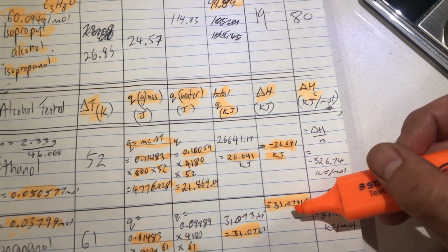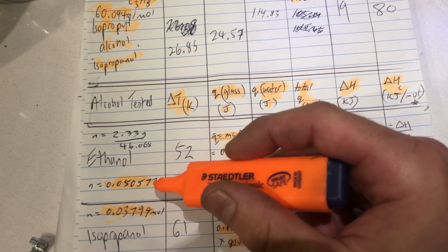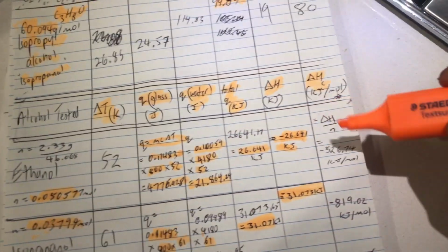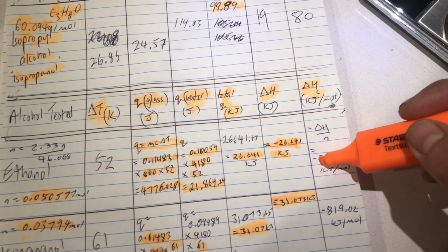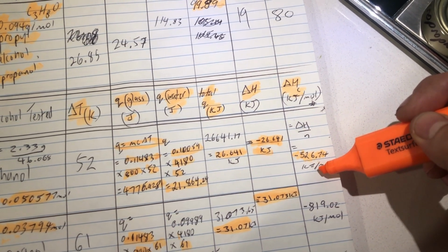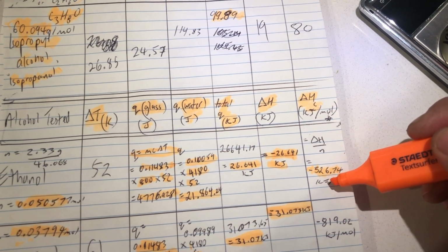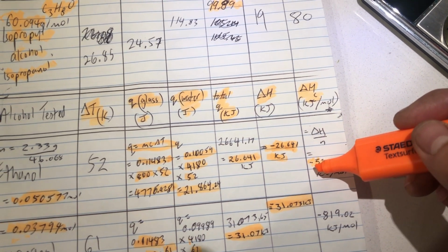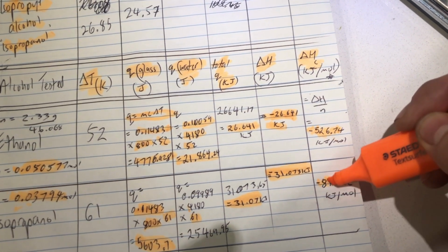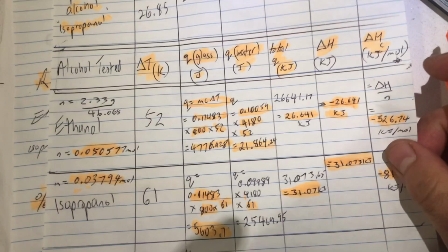Dividing that by the moles that we calculated previously gives the amount of kilojoules we would have been getting for every mole that we were using. Had we used 46 grams of ethanol, we would have expected to obtain that much energy into our surroundings, 526 kilojoules. But if we are representing it as not just a raw heat of reaction value, we need to put a minus there to show it is a change in enthalpy value. The change in enthalpy for the bigger alcohol is bigger, minus 819 kilojoules for every mole that we were burning.